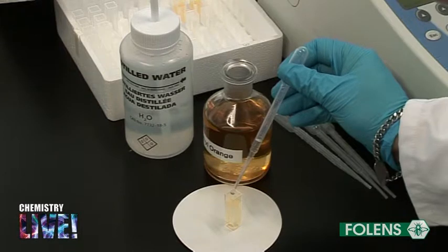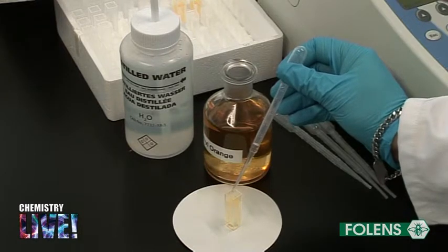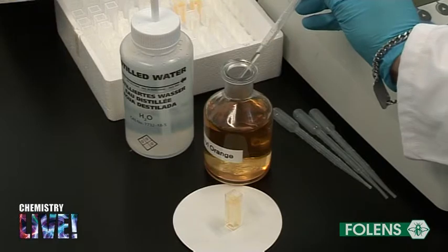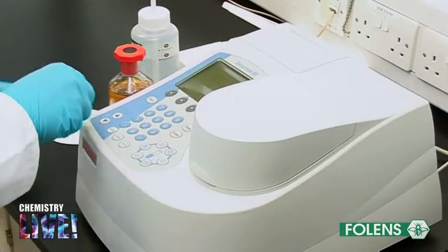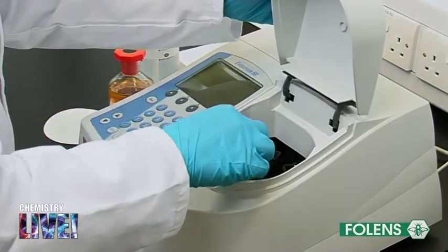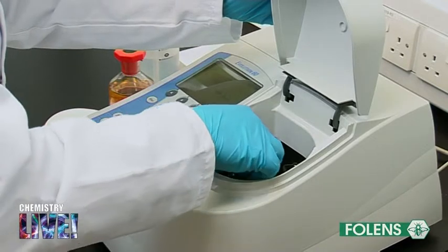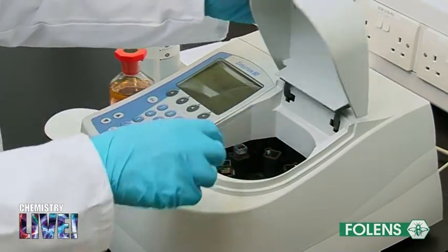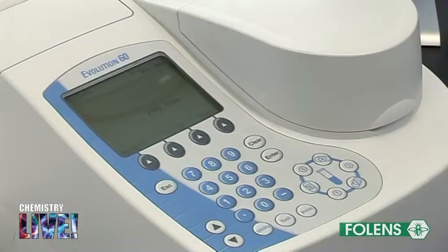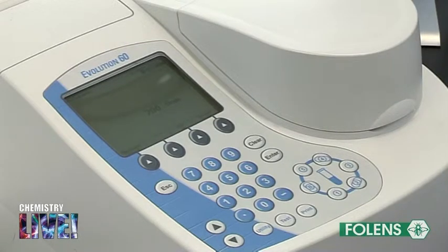A solution of the substance being analysed is placed between a source of UV light and a detector. The substance being analysed is contained within a cuvette, which is typically made of quartz, as this does not absorb UV light. The detector measures the intensity of the light reaching it.